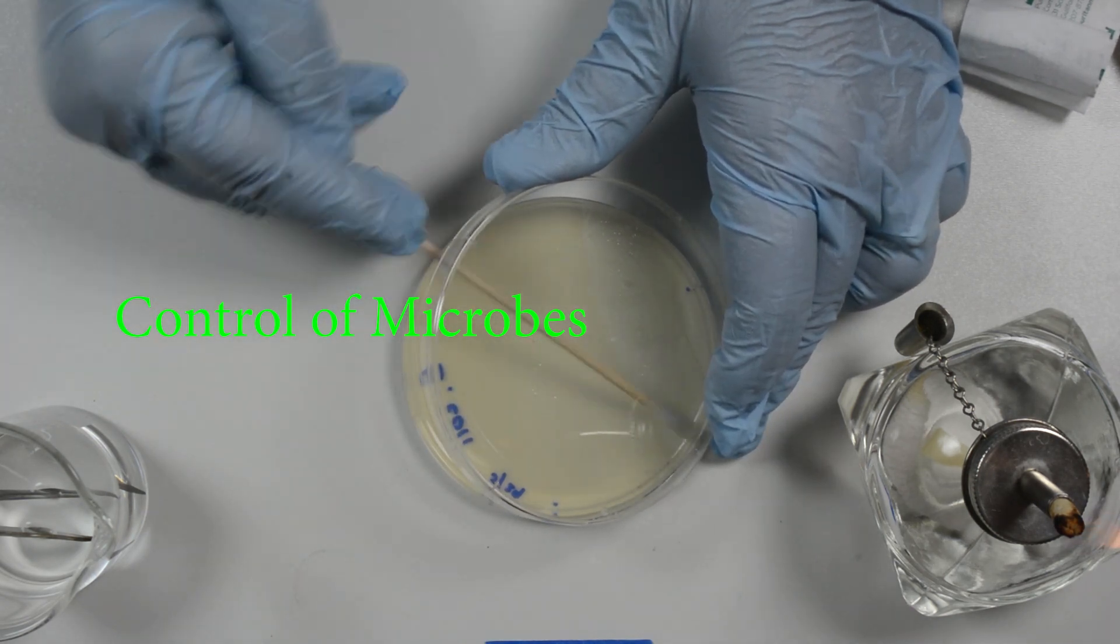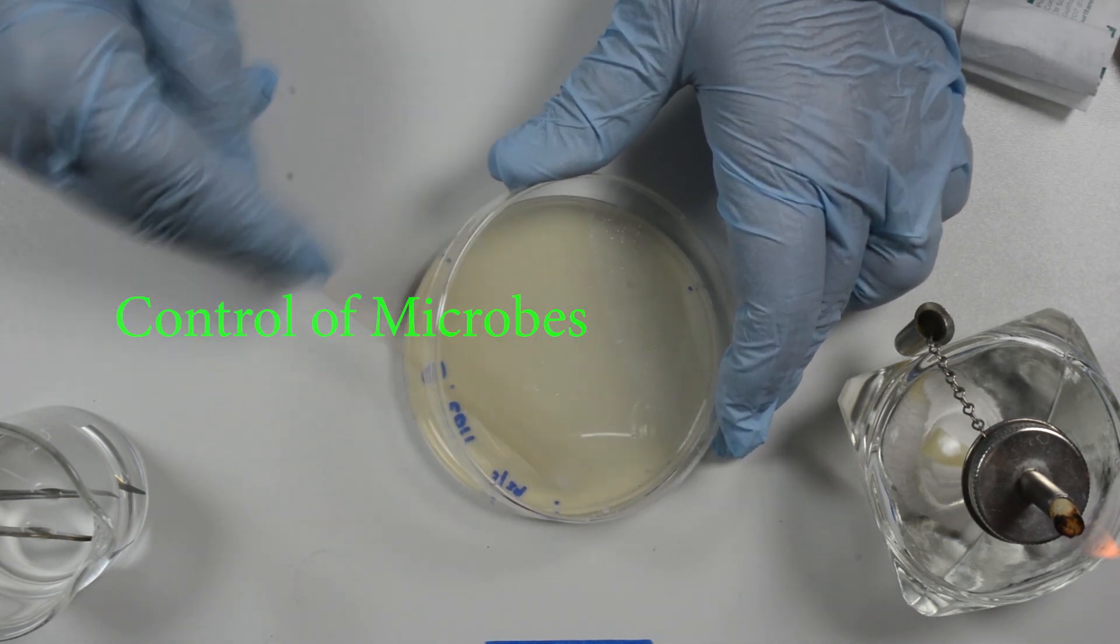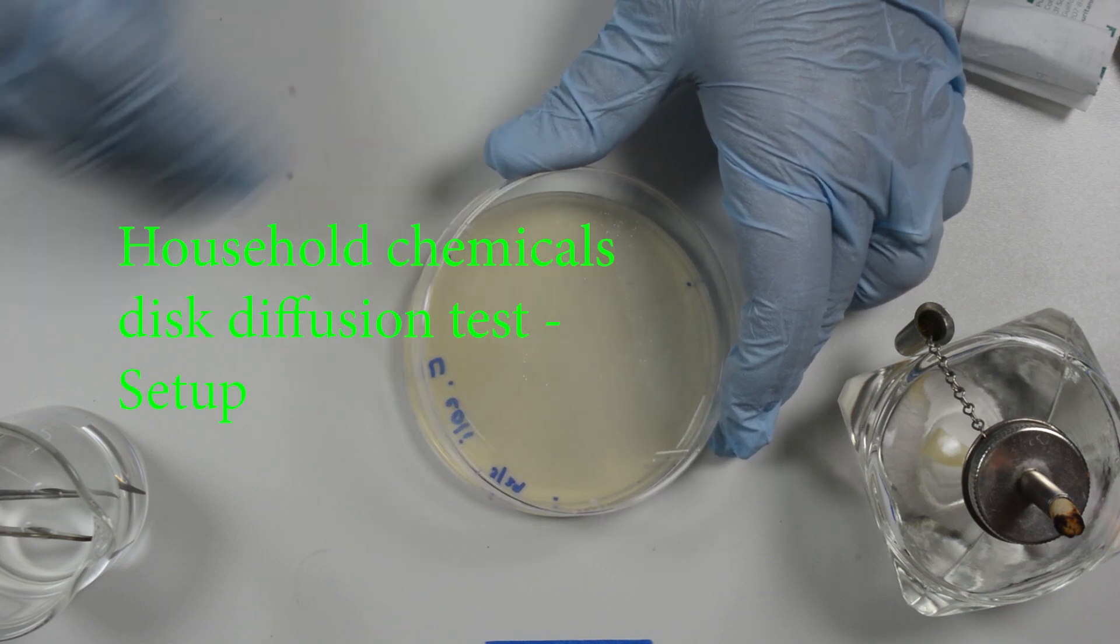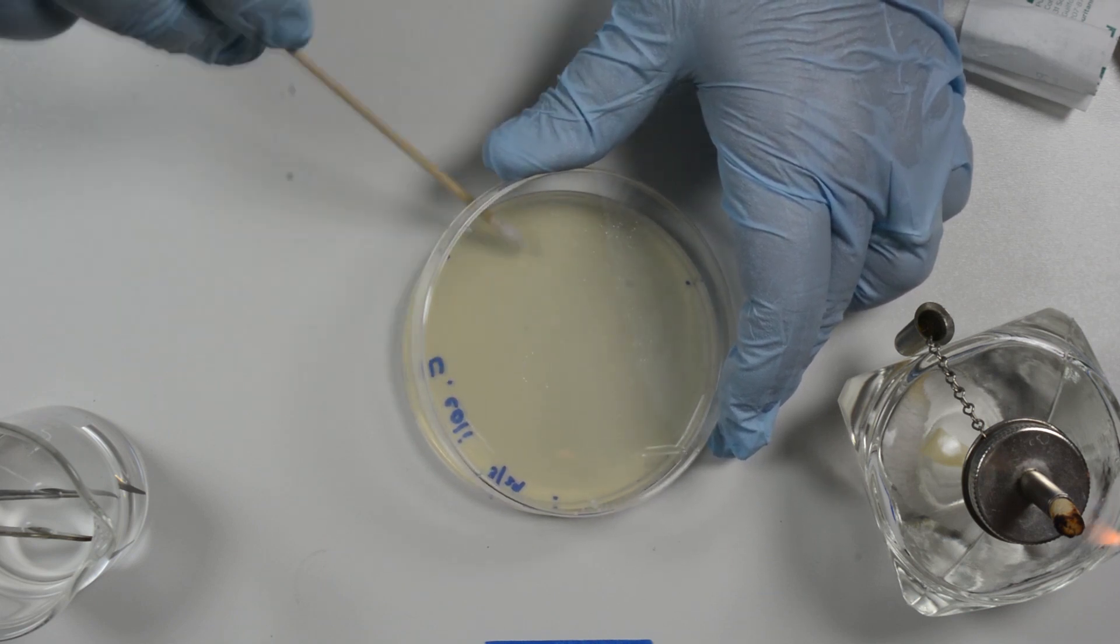To test for the effectiveness of disinfectants and antiseptics, we used the same method to evenly cover the plates with a lawn of bacterial sample.